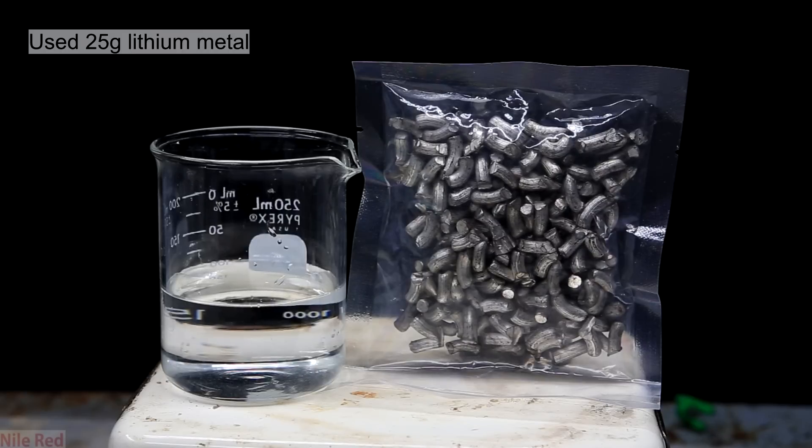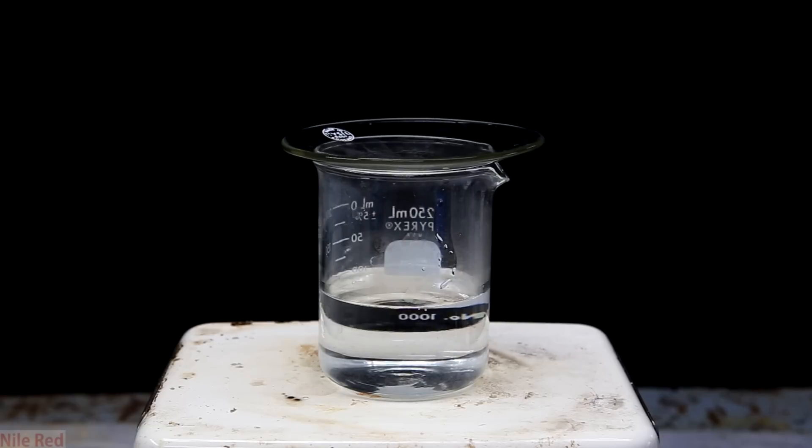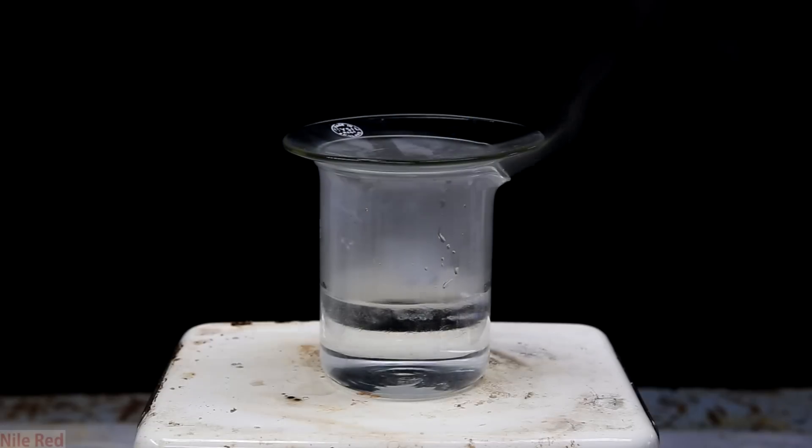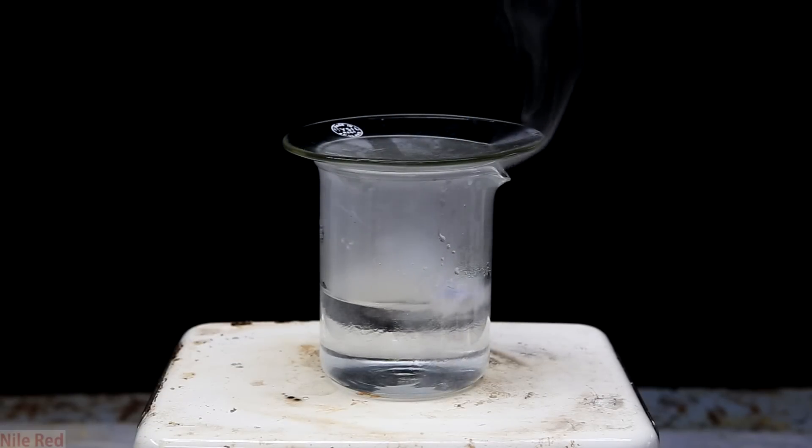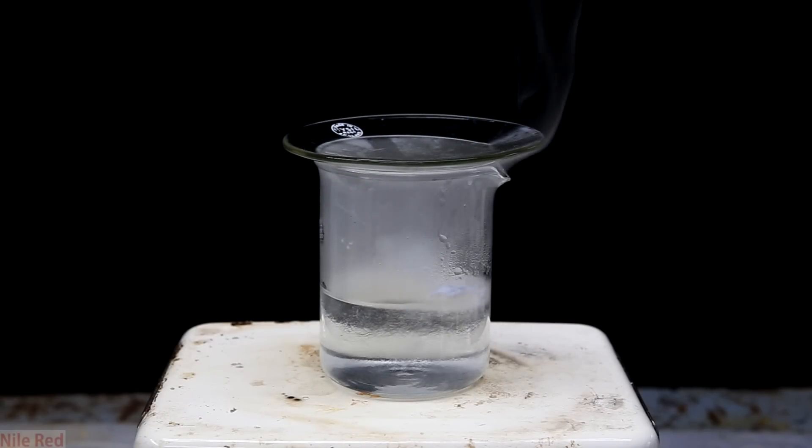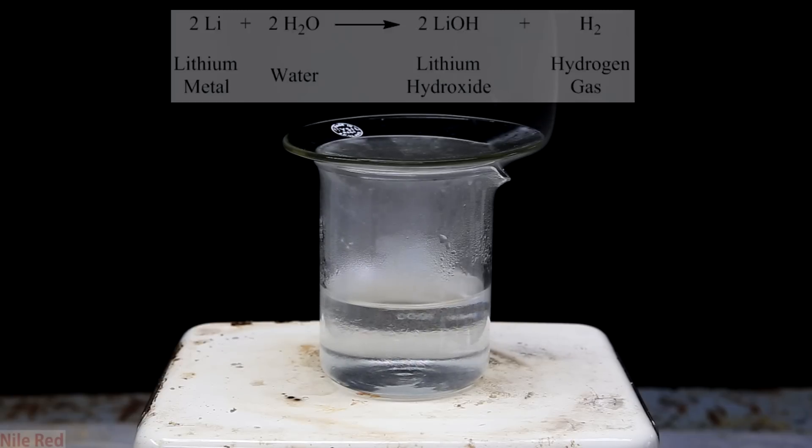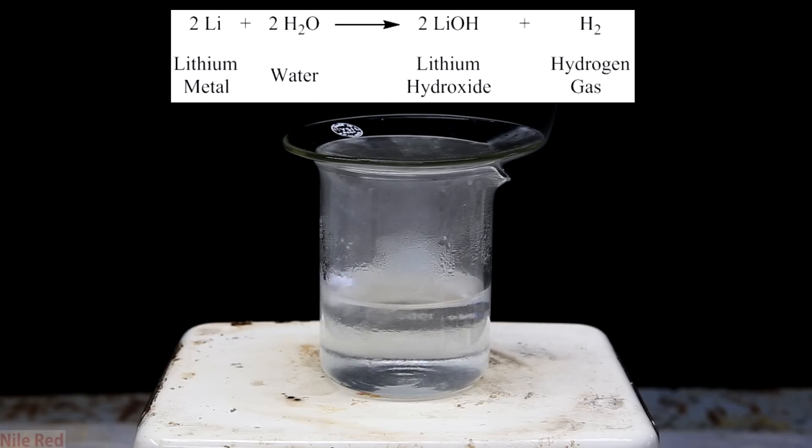You can see here the 25 grams of lithium that I got off eBay. So I have a beaker filled with water, I put a watch glass on top to limit splashing, and I start dropping in the lithium. Lithium reacts the least violently with water out of all the alkali metals, and as long as not too much is put in at a time, we really shouldn't have a problem with fire. It reacts with water to form the lithium hydroxide and hydrogen.